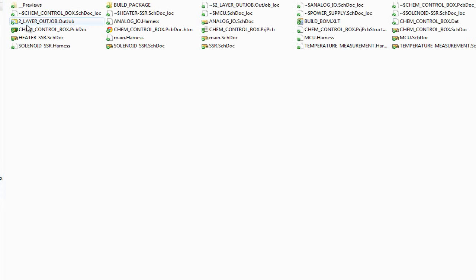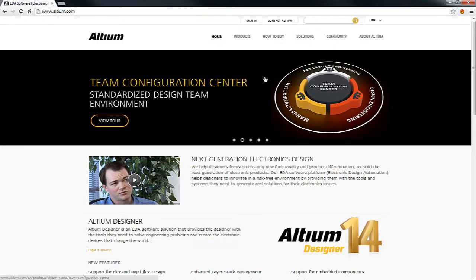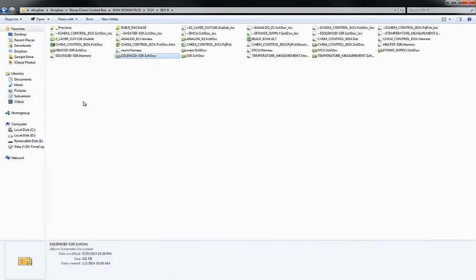So if we go in any one of these folders, I can see the layout of the files. Just for your reference, the actual package used for the schematics is Altium Designer. You do not need to own a copy to be able to look at it, but if you go to altium.com, you can get an Altium Designer viewer license. It's a fairly expensive tool, but if you want to look at the raw schematic files, you can. I provide some PDF outputs, so you can look through the PDFs if you want. But if you ever want to really look at the raw design files, they do have a viewer, the Altium Designer viewer. It's free, you'll be able to get a hold of it. So that's what the files are.